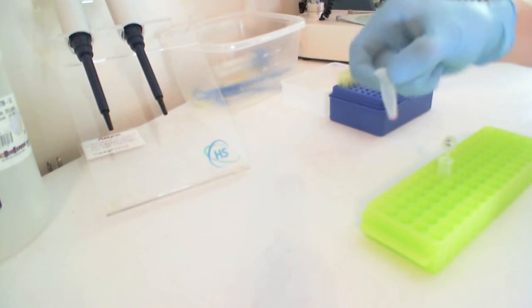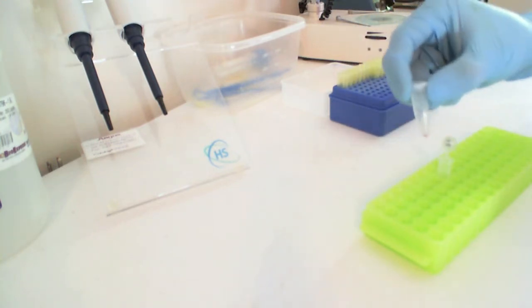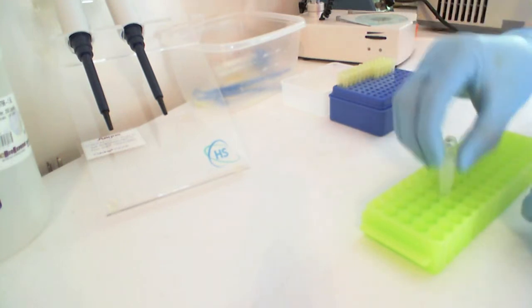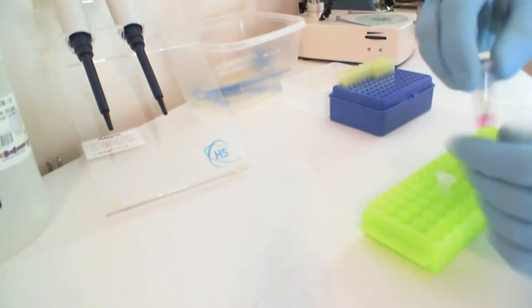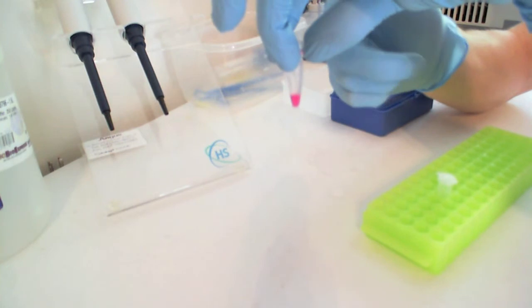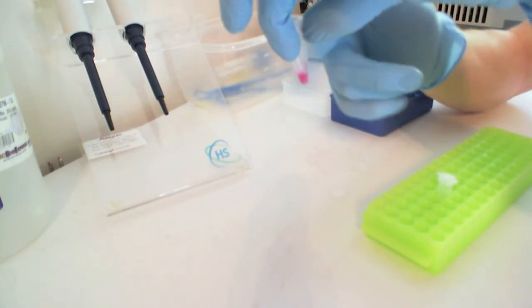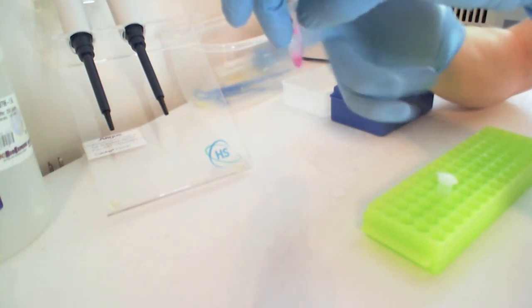Here's some extra tips and tricks for dealing with the microcentrifuge tubes that you'll be using throughout the lab. Sometimes you need to mix the tubes and the easiest way to do that is to do what we call flicking. Simply tap the tube with your finger right at its bottom and it will move the liquid around, getting it mixed up nicely.